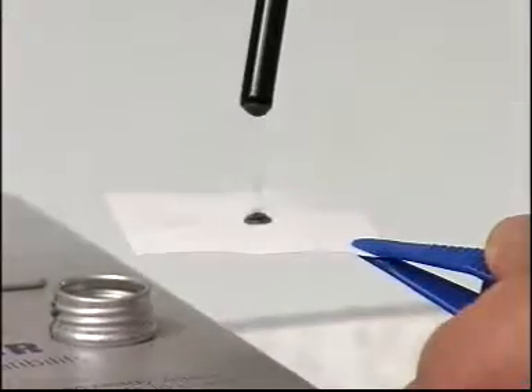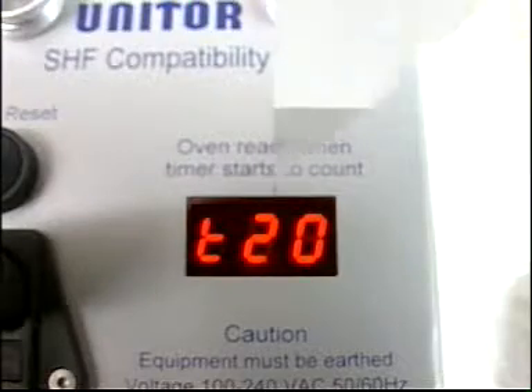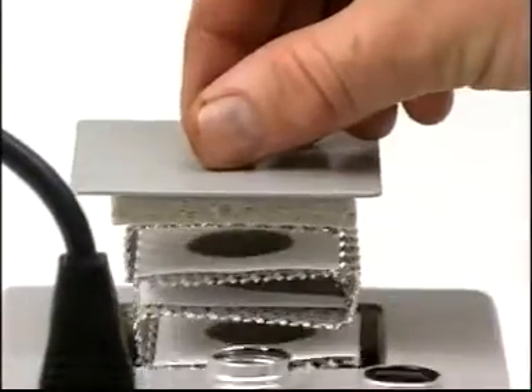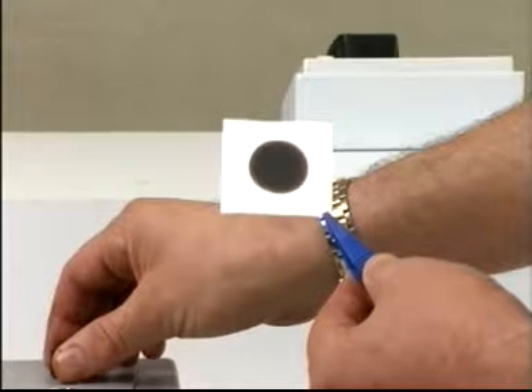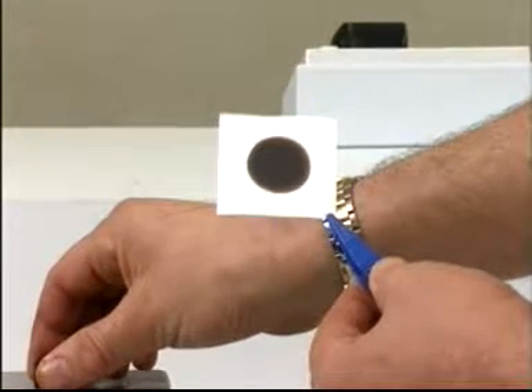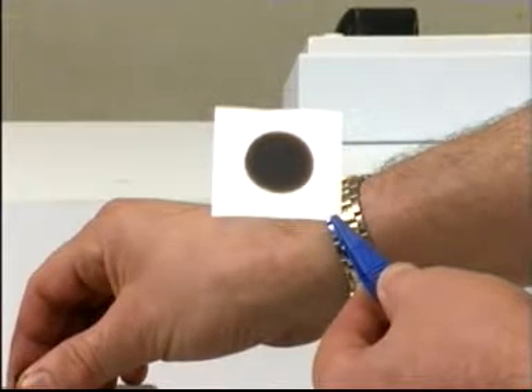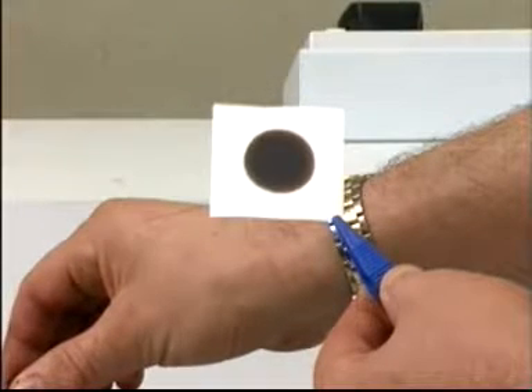Place the paper or papers in the oven, press reset, and wait for 20 minutes. Remove the paper and compare it against the spot rating chart. Ignore all other characteristics of the spot except the center ring. Any rating other than one means that the oil is likely to deposit sludge to some extent.